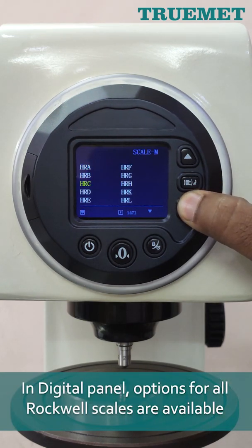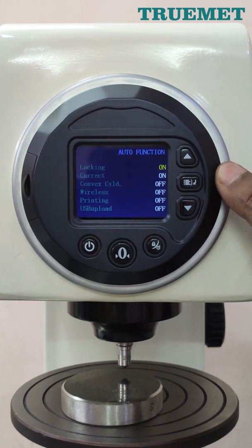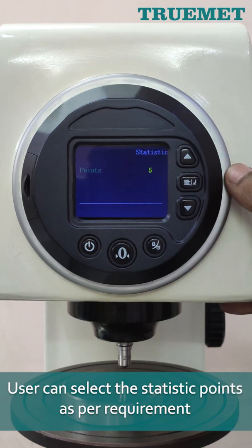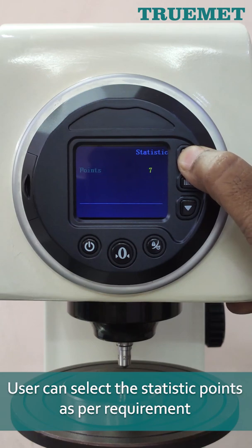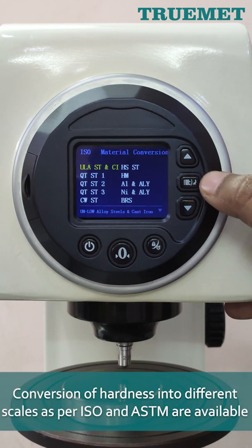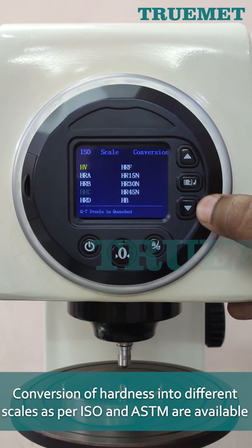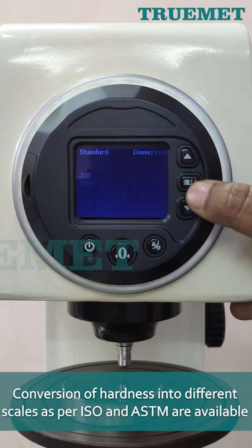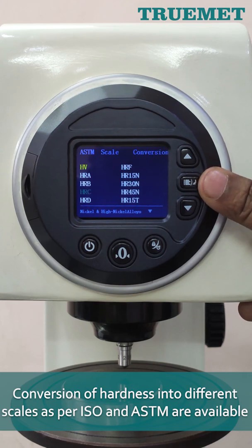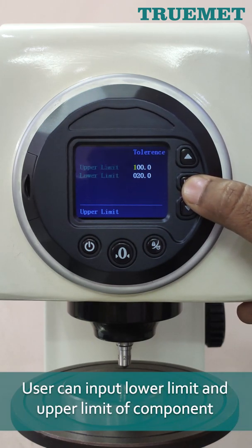In the digital panel, options for all Rockwell scales are available. User can select the statistic points as per requirement. Conversion of hardness into different scales as per ISO and ASTM are available. User can input lower limit and upper limit of the component.